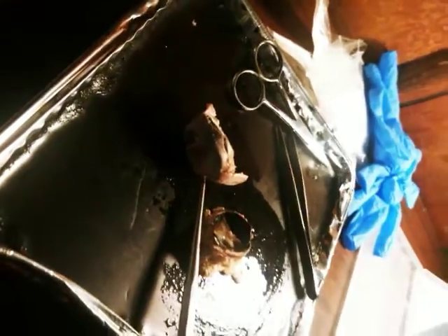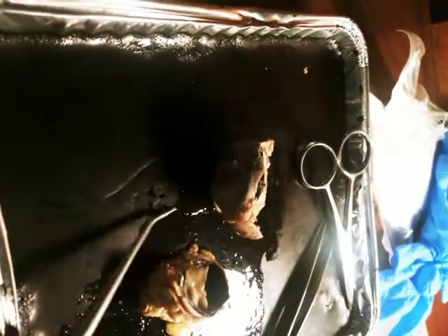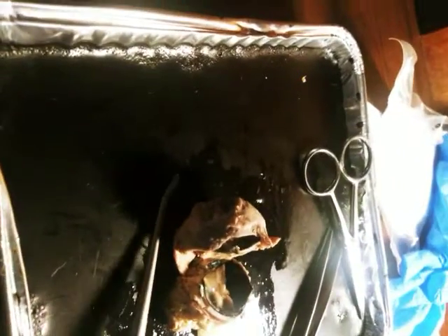I tried my best with the eyeball. I tried my very, very best. Like I said, it was my first eyeball dissection, so I'm sorry that you can't really see the eyeball too clear. But I hope I was able to point out some of the areas. I tried to trim off the muscle, but it would not come off, so I couldn't get a clean eyeball dissection. But that's the best I can do. Thank you.